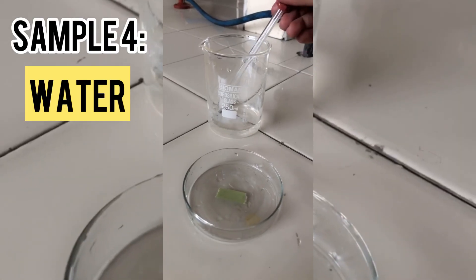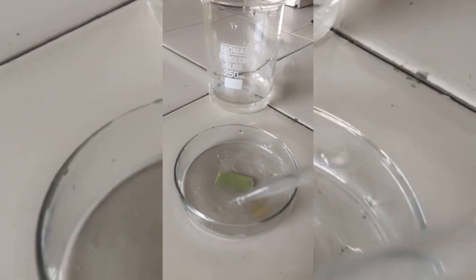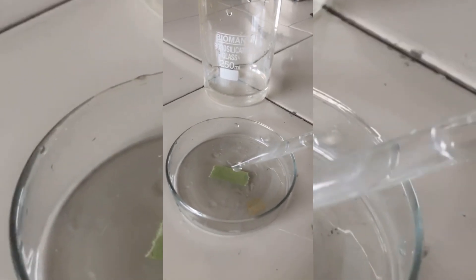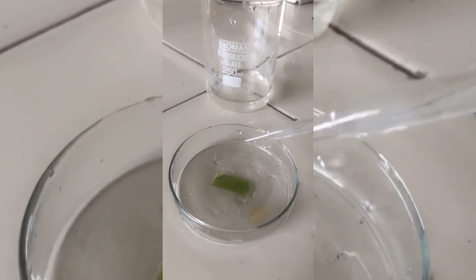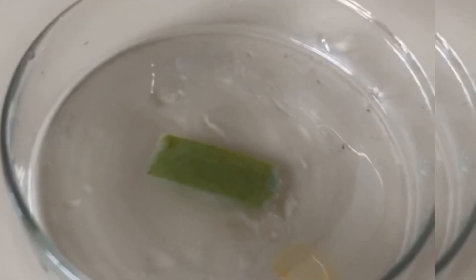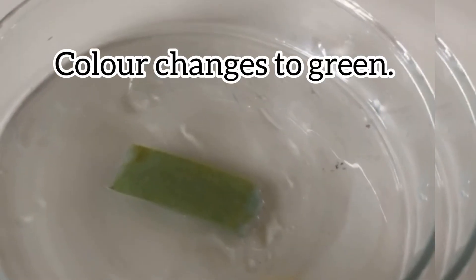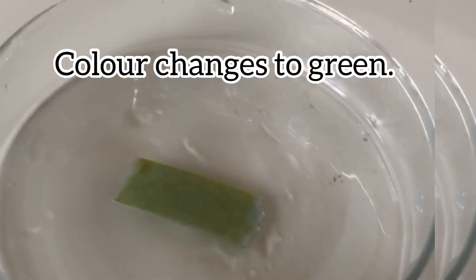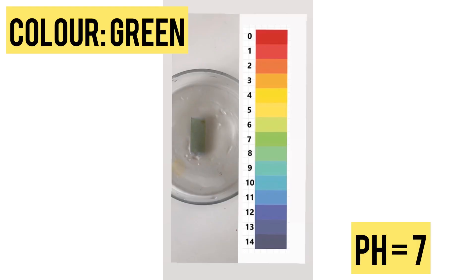Next we are trying with water. You can note the color change is green. It corresponds to pH 7, which means it is neutral.